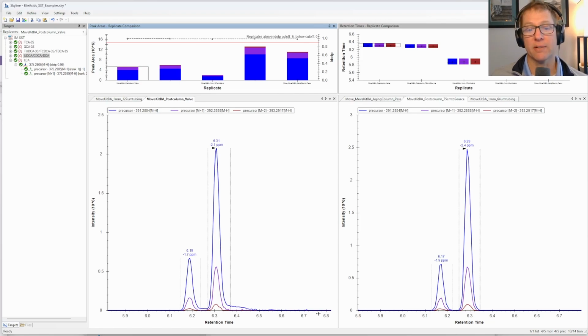And if they're not perfect, then you can really run into a scenario where you can have these long tails that will affect your sensitivity and will affect your ability to resolve some of these critical pairs, especially if there happens to be a low abundant species nearby. This can have a major effect. So those two things show the importance of the right post-column tubing, both the length and the inner diameter, and the importance of the fidelity of your post-column connections.